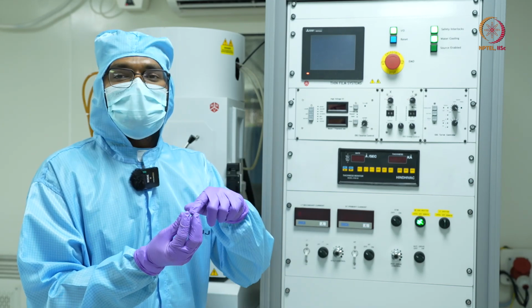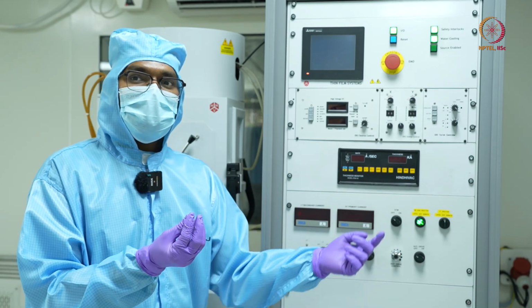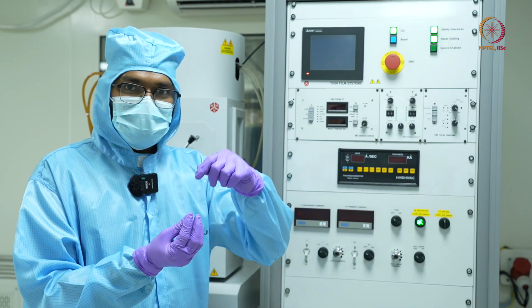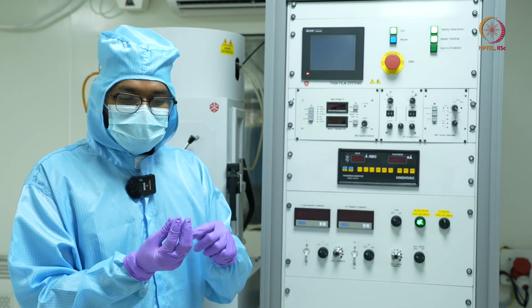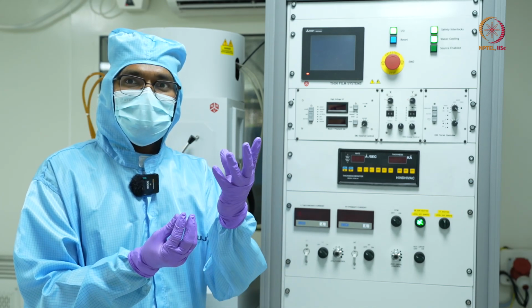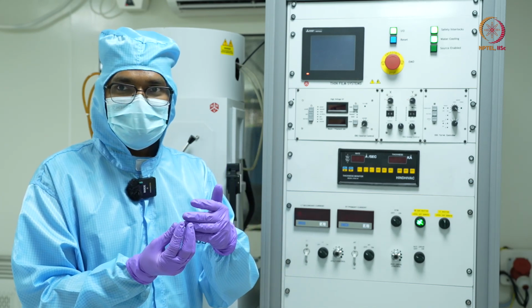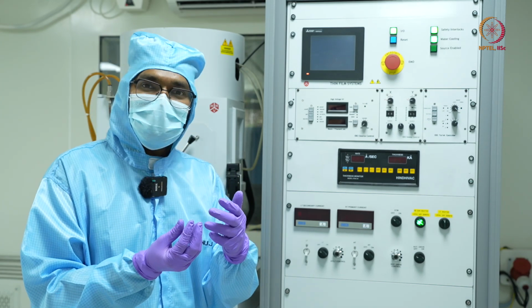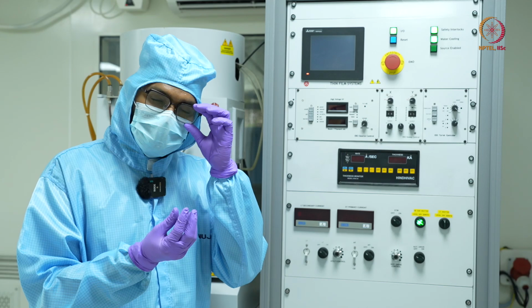So this heating which I am doing right now using an electron beam cannot be very sudden. Slowly and steadily it will start heating. So it is possible that initially, as soon as you start heating, there will be some vapor coming out, but you don't know exactly how much it is, and you cannot predict accurately what will be the rate of deposition.